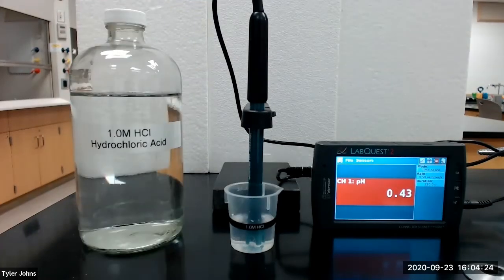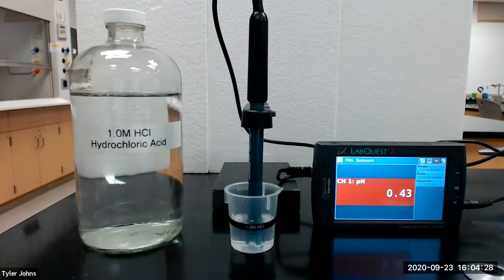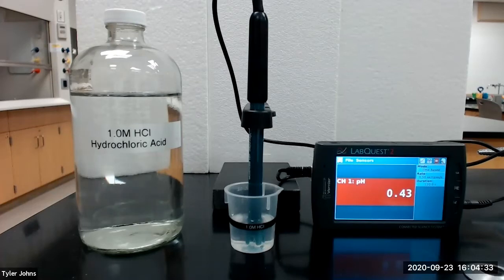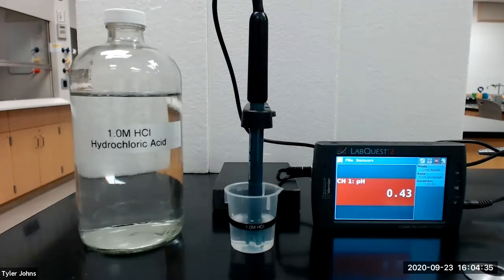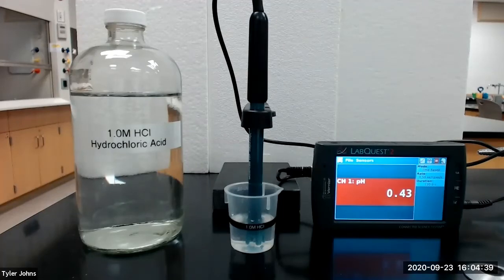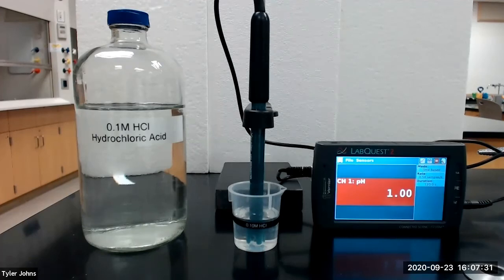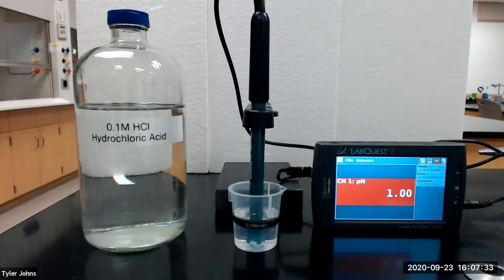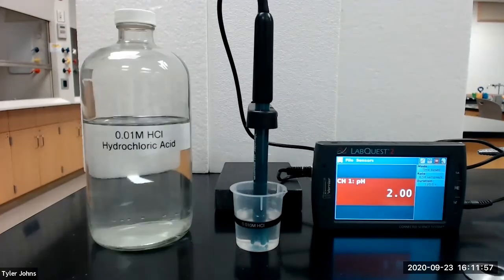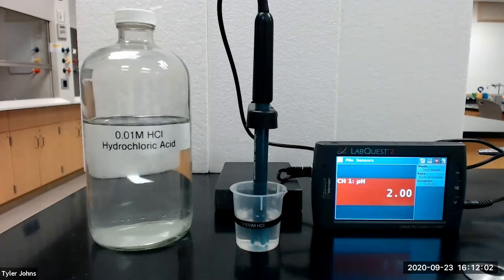For part two of this experiment, we'll be measuring the pH of different concentrations of acids and bases. The first acidic solution that we will be measuring is 1.0 molar hydrochloric acid and our 1.0 molar hydrochloric acid has a pH of 0.43. Our next solution is 0.1 molar hydrochloric acid and the pH is 1.00. Our next solution is 0.01 molar hydrochloric acid, which has a pH of 2.00.